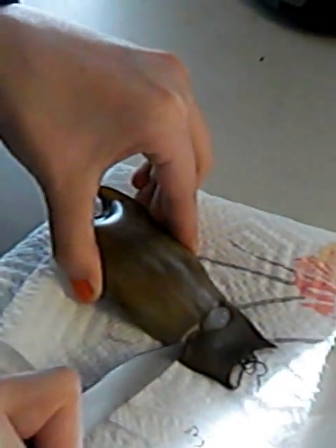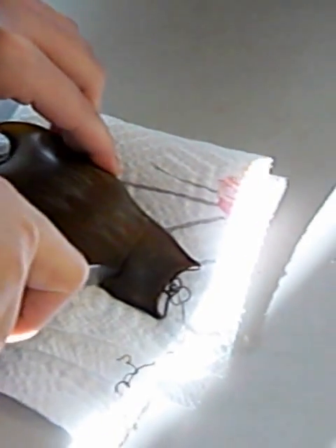Okay, I think you should put a paper towel under it. Scissors or something — that's what I need. I think you should cut it all the way through, like in half, and then open it wide. Yeah. Oh, it went back inside. Keep it in there. Might be part of the coosh.